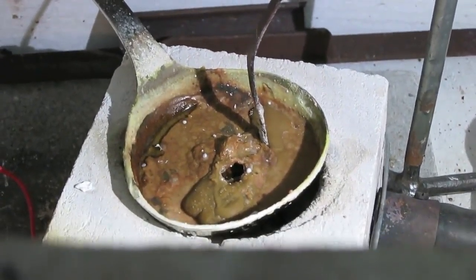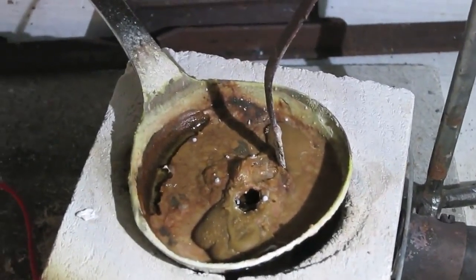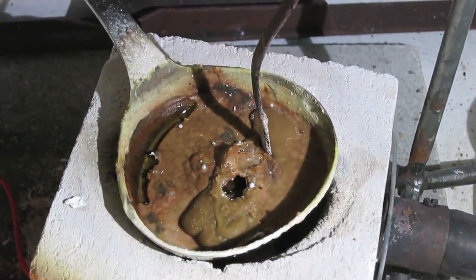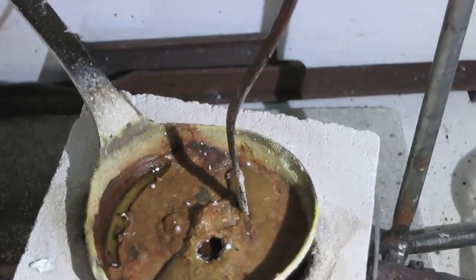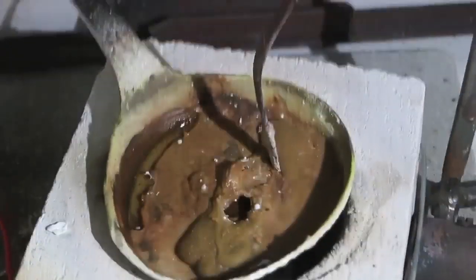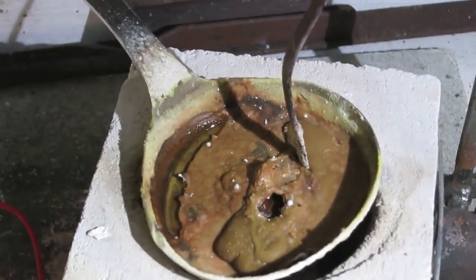The temperatures are close to the freezing point — it's about 320 degrees. As it approaches freezing, sometimes it explodes, because water is released, and that combines with the sodium, causing a reaction. So now there's a little bit of sodium metal forming, but it's under the crust of the NaOH.